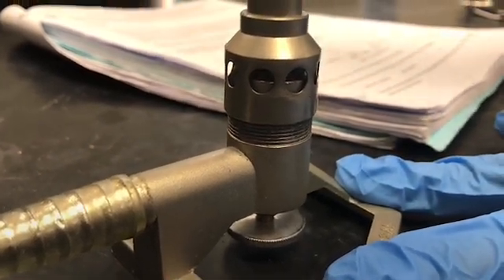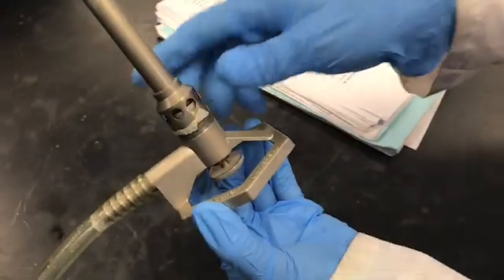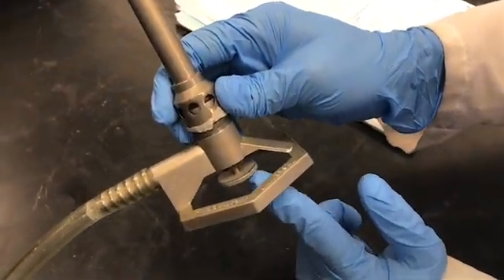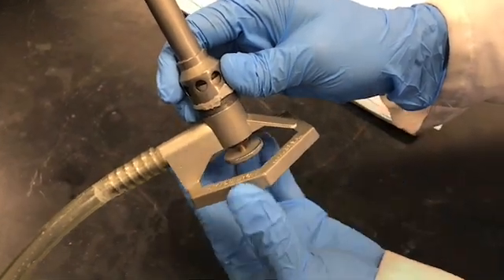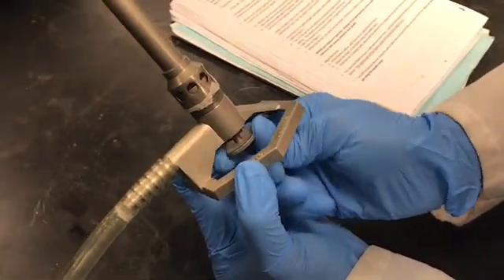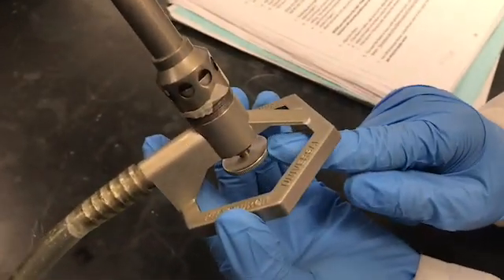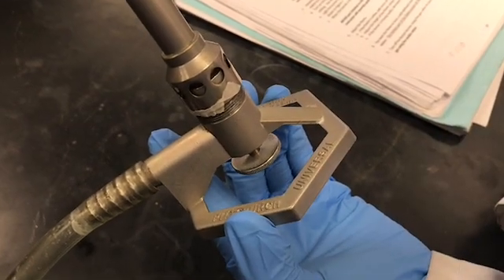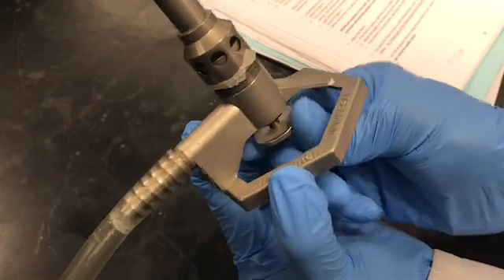Now we're going to focus on the gas needle valve. First, check whether it is jiggling or not. If it is not jiggling, it is safe to use. If it is jiggling, you should immediately inform your instructor because it is not safe. This one is safe to use because it is not moving around.